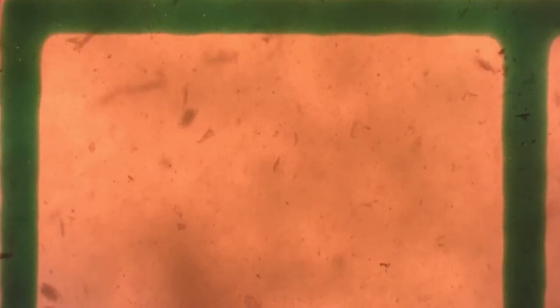Now we'll look at a video of the slide I just prepared. I like to start off by placing a portion of the slide that has some print on it directly under the eyepiece to get my focus fairly close. Then as I adjust, I immediately see two football-shaped nematode eggs. We move down one field of view at a time, staying within the grid lines, looking for that shape. It's easy to get distracted by all the debris in this sample, but again, that's mostly just partially digested plant material. Here's another nematode egg to the right.